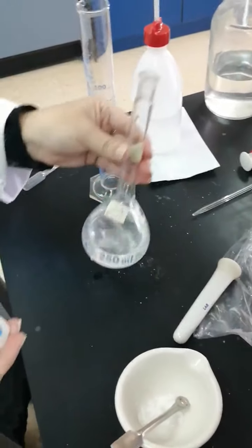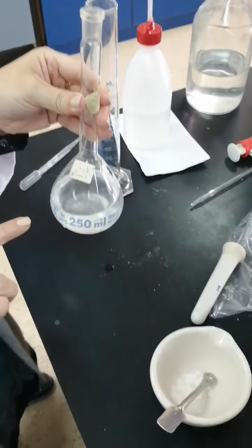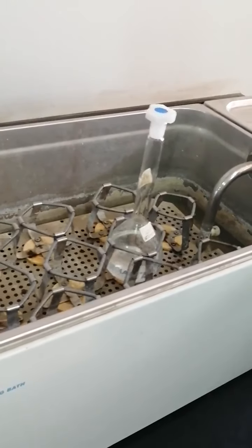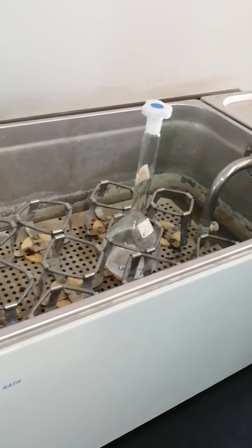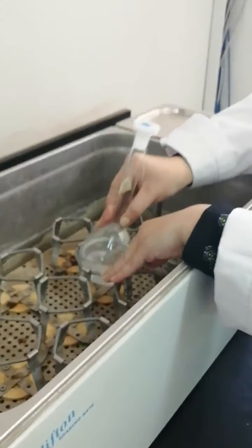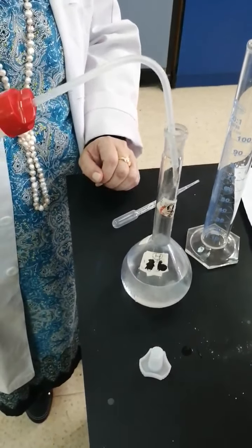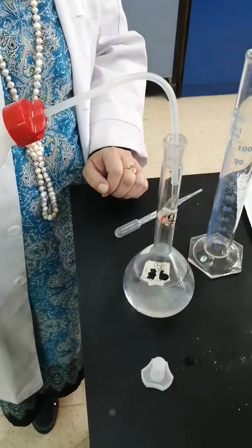For the whole test, content uniformity or weight variation, we are going to do that 10 times in stage 1 and another 20 times for stage 2. So after that, we are going to close it, label it and put it on the shaker for the whole 15 minutes at room temperature to enable the active ingredient to dissolve completely in this mixture. After the 15 minutes is completed, we are going to take that mixture and complete the volume to QS 250 using distilled water. This procedure is according to the pharmacopoeia.